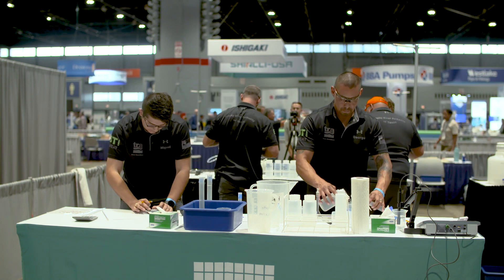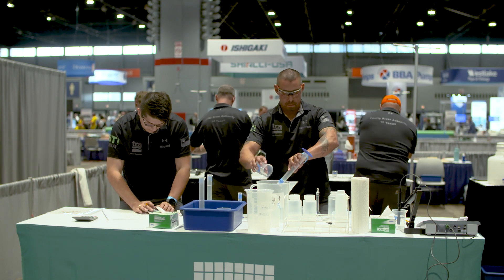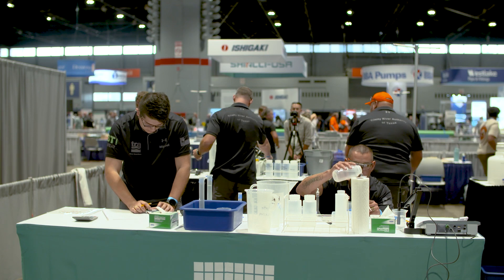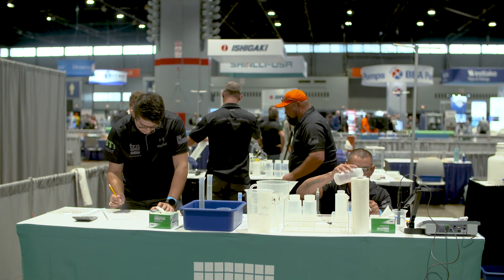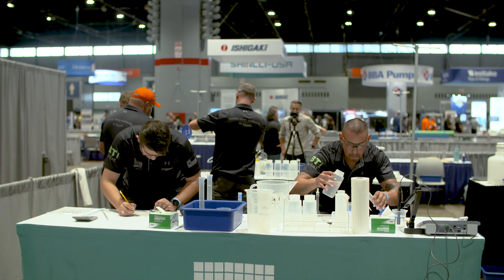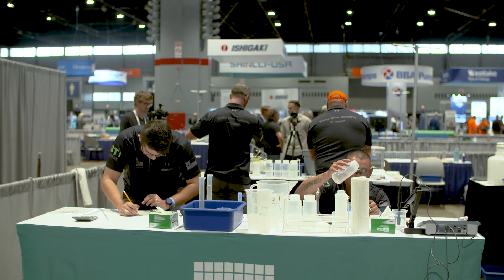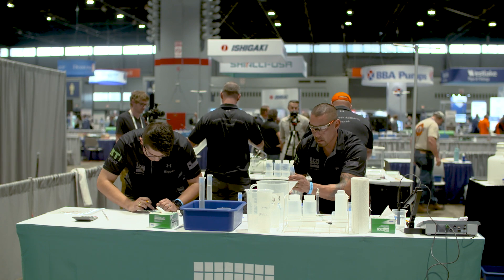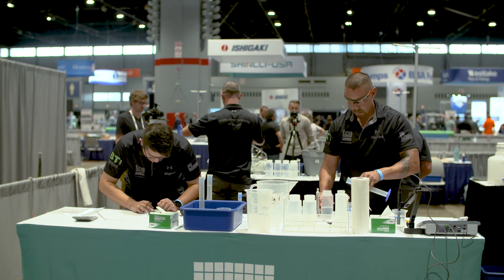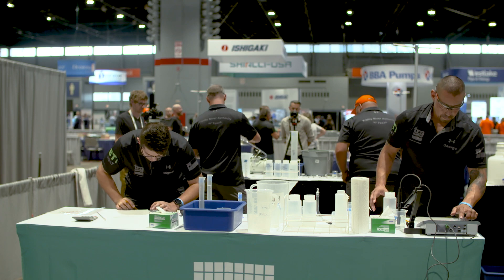You will need to shake again if you set the sample down after inverting, so make sure that you're mixing and pouring immediately into the graduated cylinder — it's very important. Proper rinse technique is important on this table as well. Make sure you are rinsing all of the glassware properly, hitting that meniscus. You want the bottom of the meniscus — that's what you're measuring and reading.